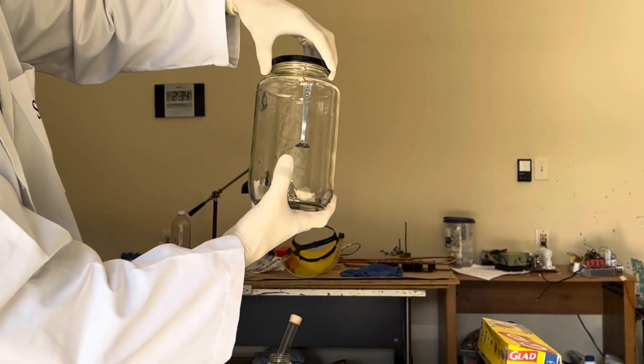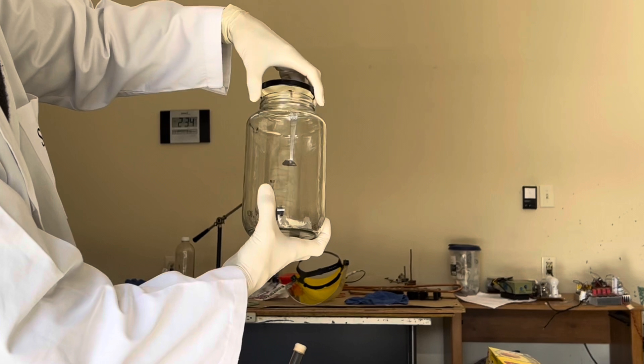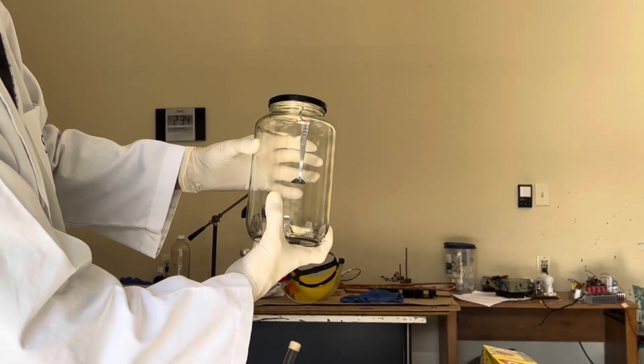I'm going to leave this lid a little bit loose. So if any pressure builds up in this bottle, it's not going to explode or anything like that.